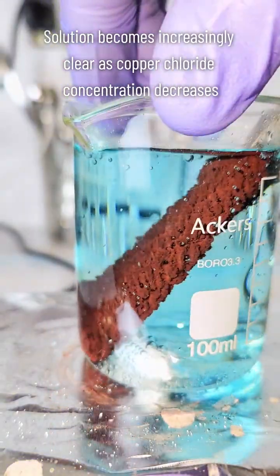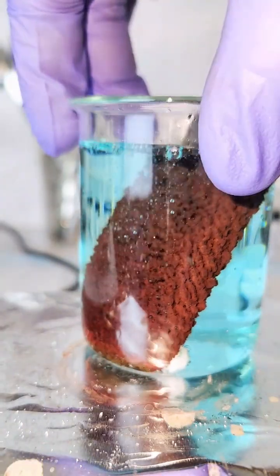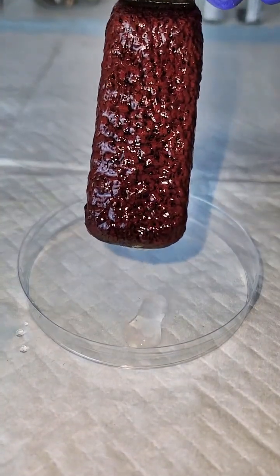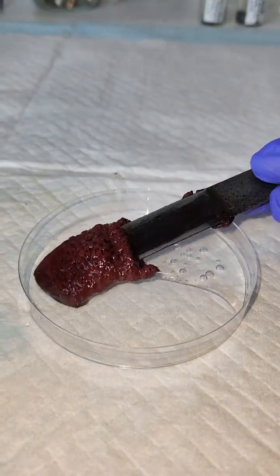In any case, eventually the solution is going to turn basically clear and the electrode is going to be completely covered in copper. The reason the solution turns clear is because the blue color came from the copper chloride and is replaced by zinc chloride, which is clear. And that's all I have for today.